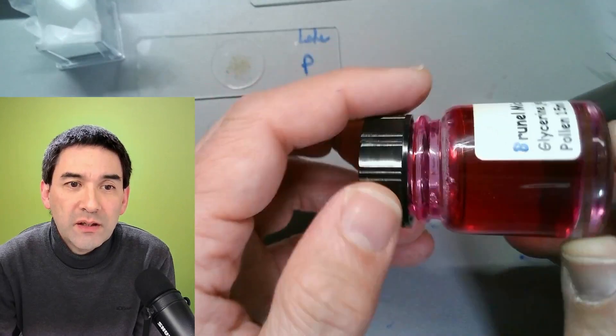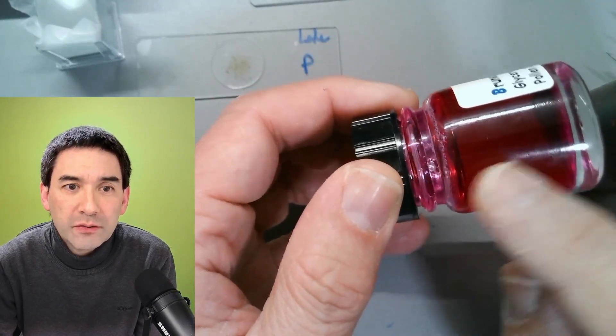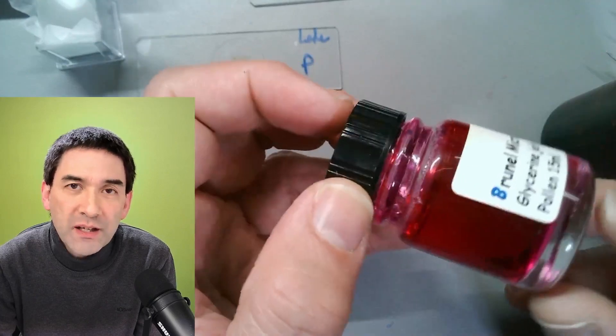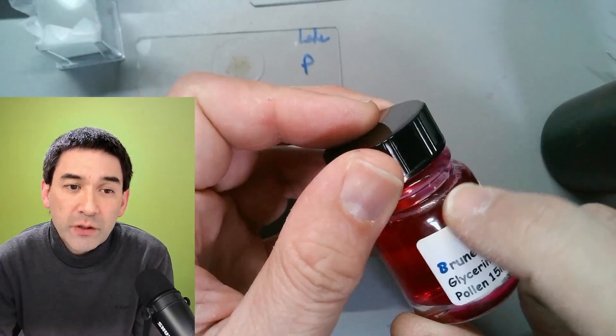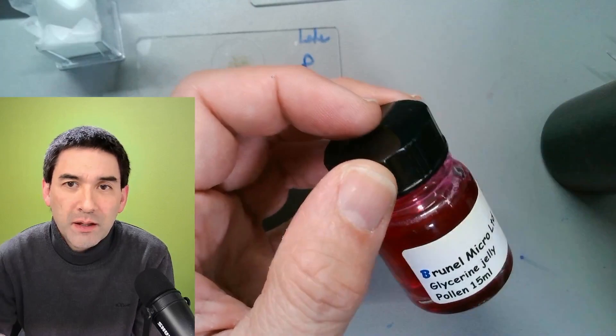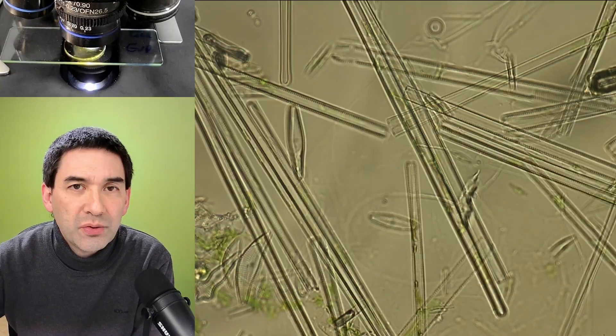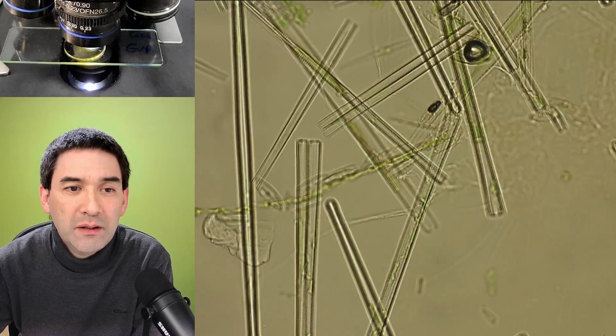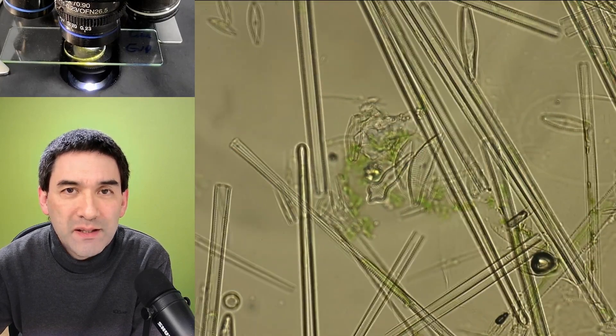You see, it's solid, right? It's solid because I have to melt it at 40 degrees, and also the slide has to be prewarmed. You can see already over here there are some bubbles as well. Just wanted to show you the effect that mounting media indeed have on the specimen.